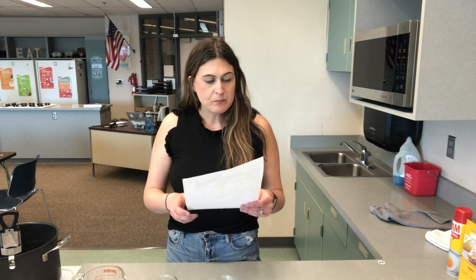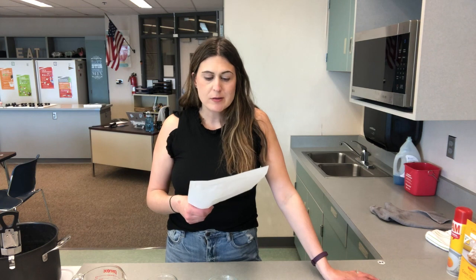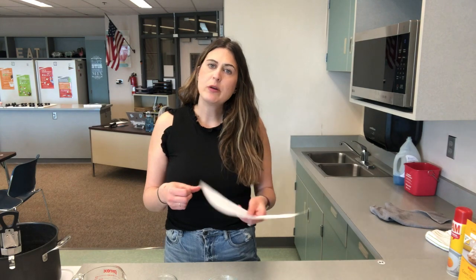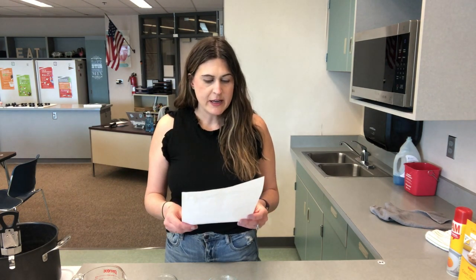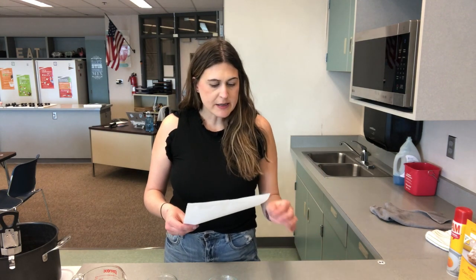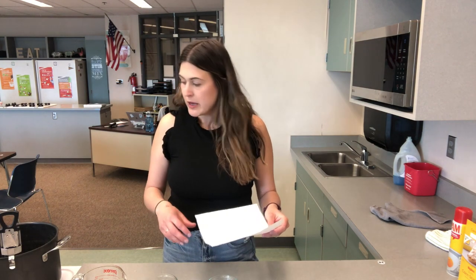So the products of fermentation, which are alcohol and carbon dioxide, are what make those baker's essentials to bread making. We need that carbon dioxide to form to create little bubbles. We use carbon dioxide to form in quick bread when we use our chemical leaveners like baking soda, baking powder. In this case, it's the active yeast that's doing that, and the formation of gas makes that rise. So this experiment is designed to see what type of foods yeast like, which is the most favorable for yeast growth. So you'll be able to see kind of how that's bubbling up and growing.